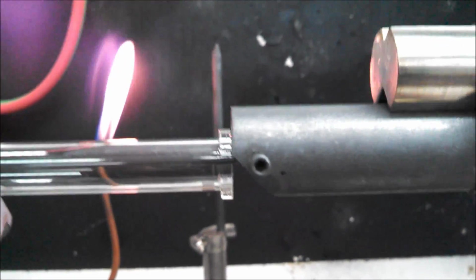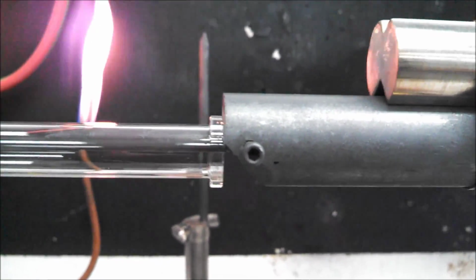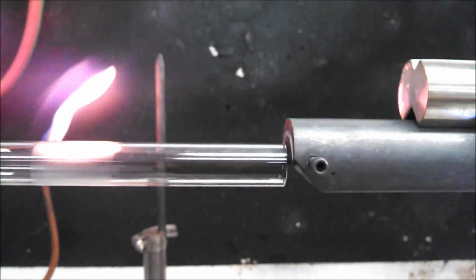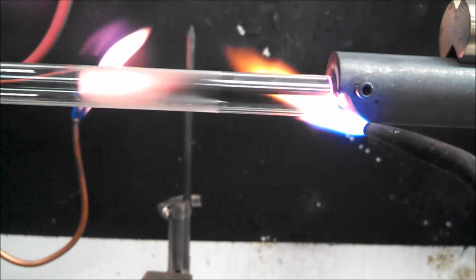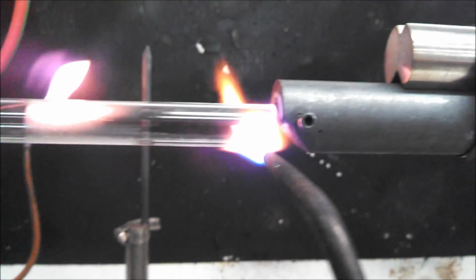Hope that helps. I'm going to go ahead and demo one now. I'll try to hold it and do as best I can, but we'll see how it goes. This is going to be hard for me to show you because I'm holding the phone at the same time, but you notice I have a gap right here so I can put my flame on the bottom to get the glass to go back. And what I do is I heat about a quarter of an inch.